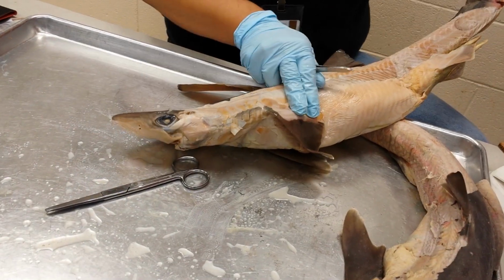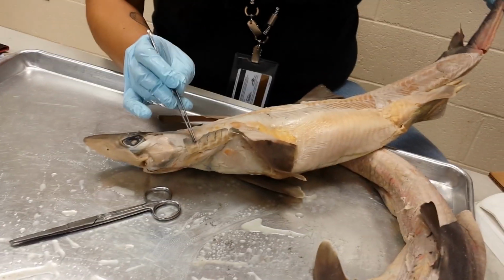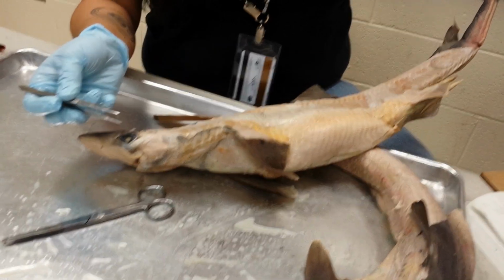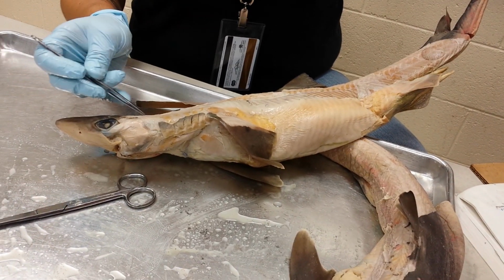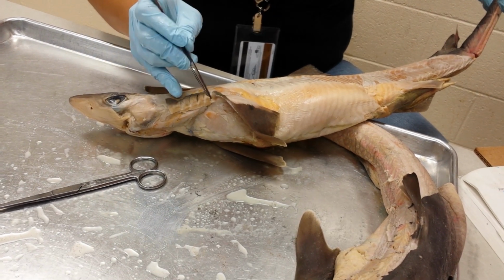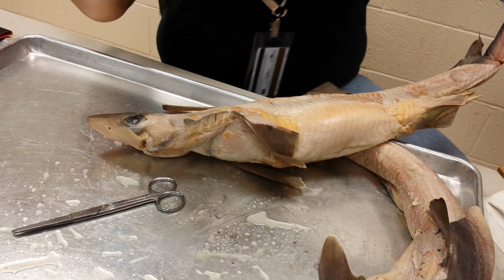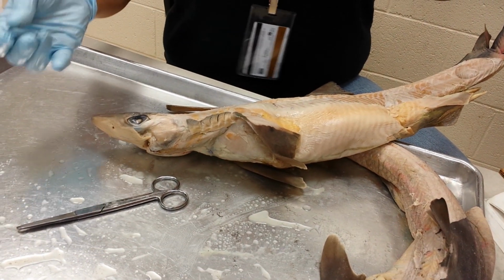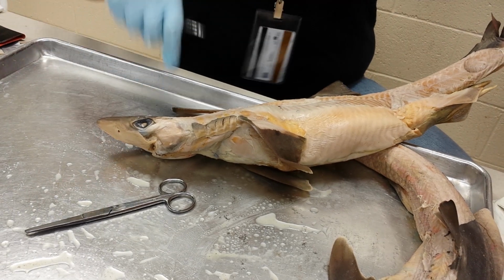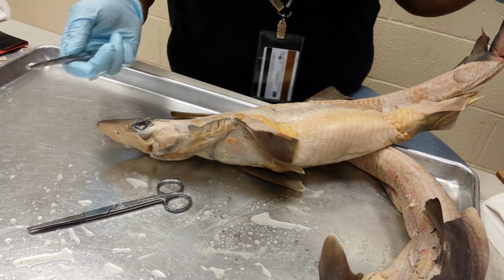So we're going to travel more caudally, or more posteriorly, and we'll notice that on the side we have 5 gill slits. The more gill slits, the more ancient you are. The fewer gill slits, the more derived. Each of these 5 gill slits opens into a gill chamber. When we cut open the shark, we're going to look more at the gill chamber, and next week we're going to study the specific arteries and veins in it.